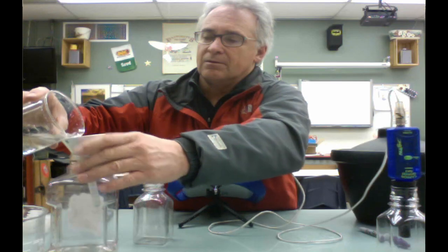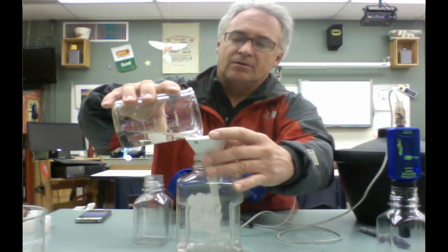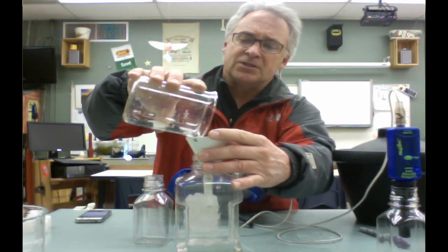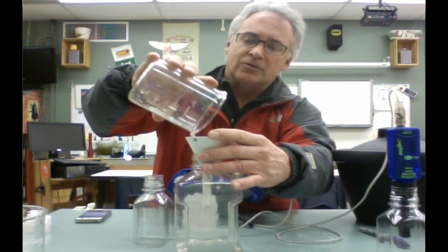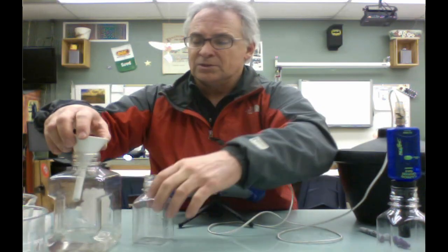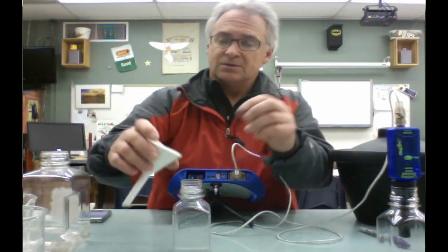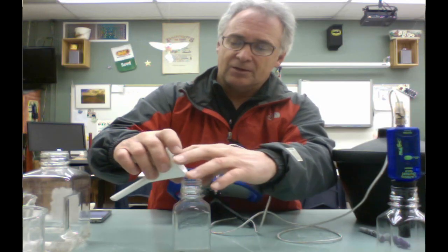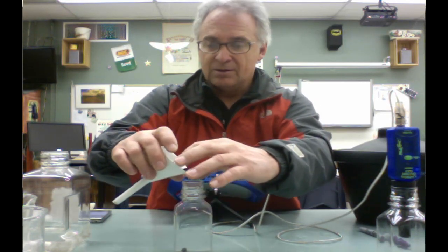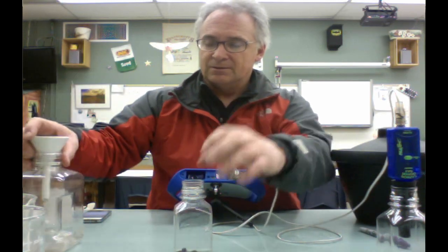All right. So we pour it off, and we're going to collect all the pea seeds. And by the way, you don't have to use pea seeds. You just have to use a dicot. That usually works the best. And we're using some pea seeds today. You could use fava beans, or beans. Either way. And we'll count 10. 1, 2, 3, 4, 5, 6, 7, 8, 9, and 10.